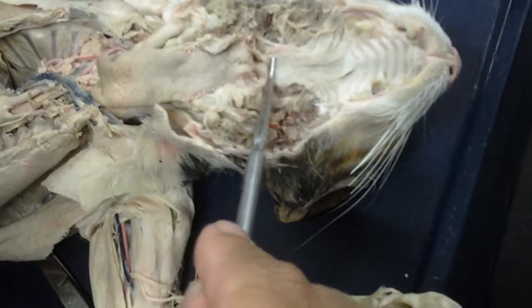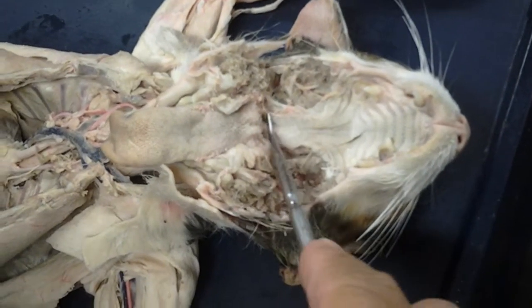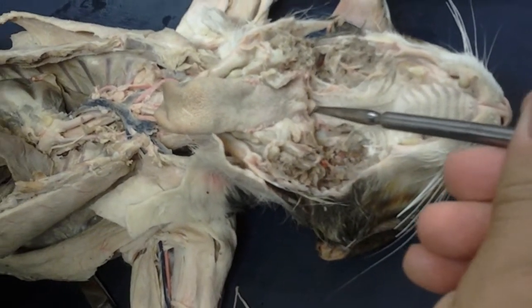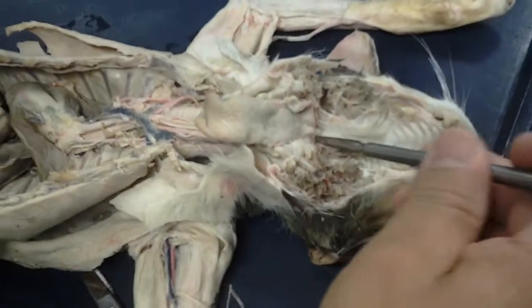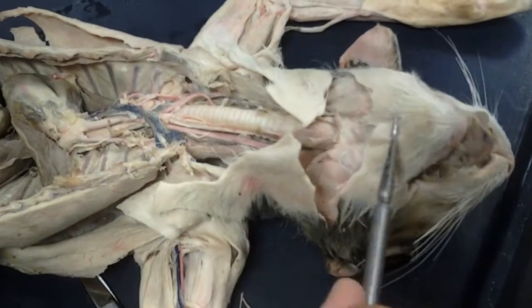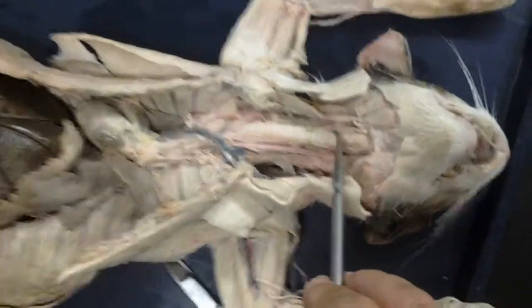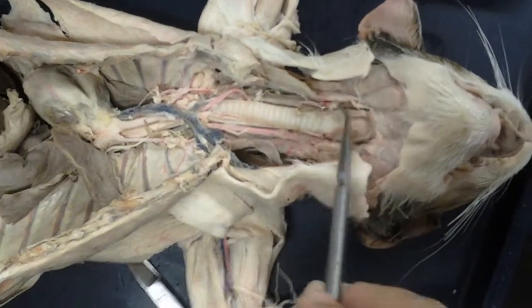Then as we made our way back down, at the end of the soft palate, you would see the oropharynx. And then as I poke down towards the larynx, this would be the laryngopharynx. That laryngopharynx would lead me either to the larynx or to the esophagus. Now obviously this is the respiratory system, so we're going into the larynx, which is this large cartilaginous structure that you see surrounded by this muscle.